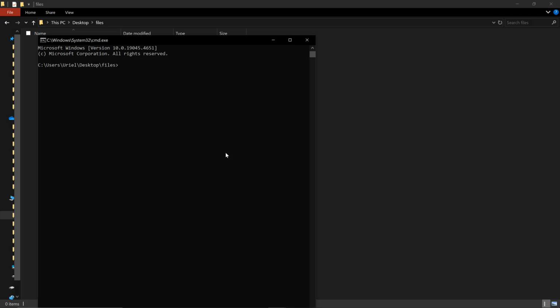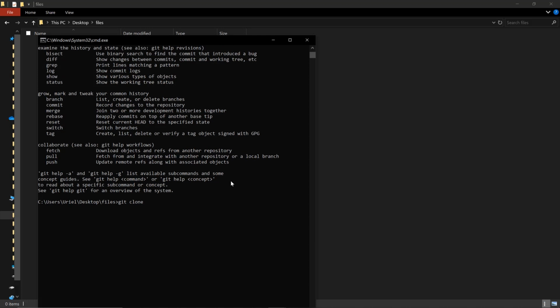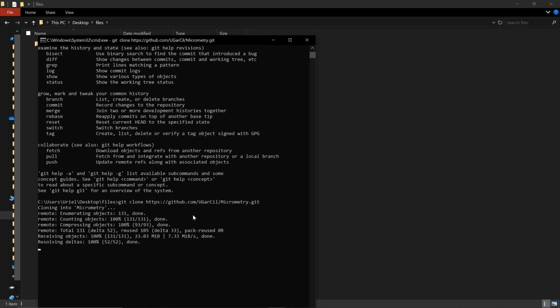to open the terminal. Then I am going to access what is known as Git. For those of you that are not familiar with Git, Git is a version control system that is connected directly to GitHub. So I can clone repositories using a secure connection, and that is exactly what I'm going to do. I'm going to type git clone, making sure that I still have the link that I copied from GitHub in the clipboard. I'm going to right click. Once I'm there, I'm going to press enter and the program will download the software. Notice that the program is quite light, even with the new extension of datasets, so it shouldn't take too long.